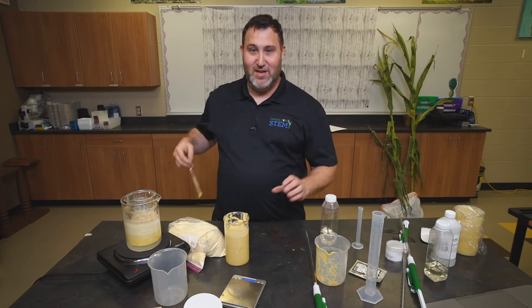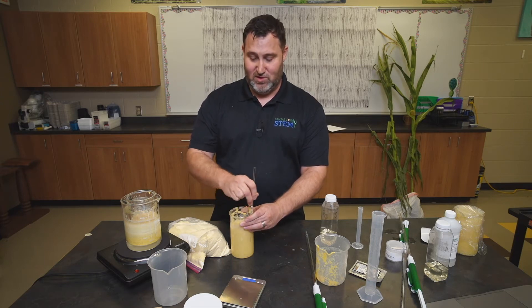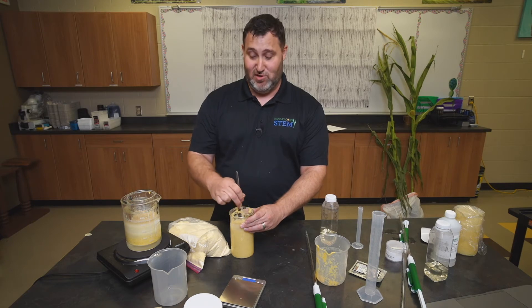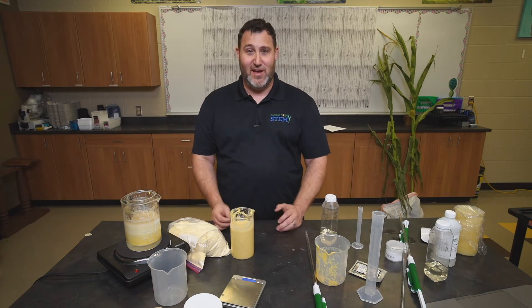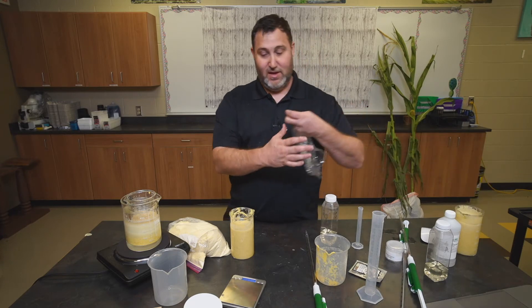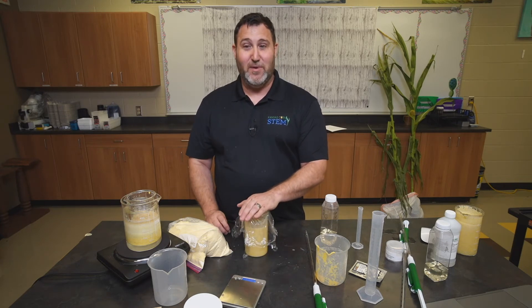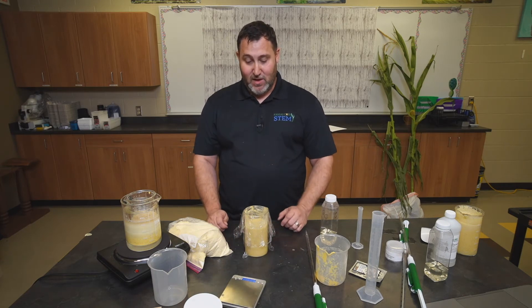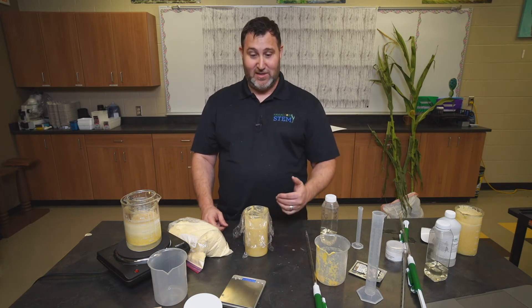This is going to conclude day one. At this point the yeast have everything that they need — they have their food source, which is going to be our corn. The enzymes in here are helping to break down that corn starch into simple sugars and glucose. The yeast are actually going to start metabolizing and creating two products: carbon dioxide and ethanol. You're going to want to take a piece of saran wrap and cover the top — don't put a rubber band over it because this is going to produce carbon dioxide. Let the carbon dioxide escape as needed, and you'll start seeing some bubbles form, which lets you know the yeast are producing carbon dioxide and ethanol.